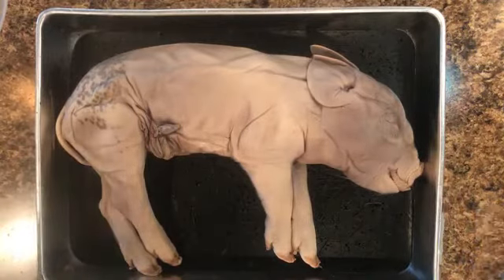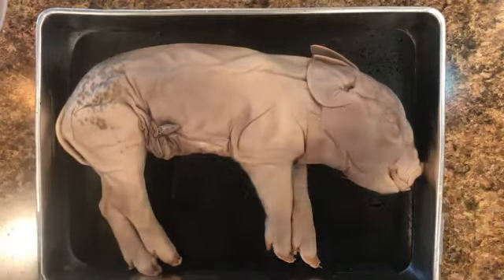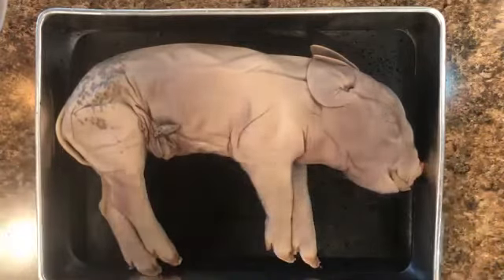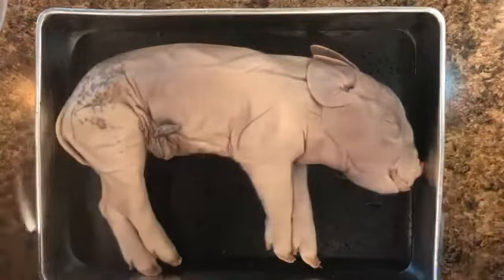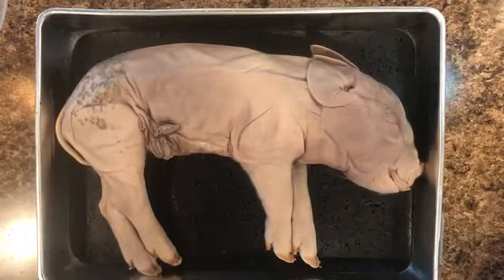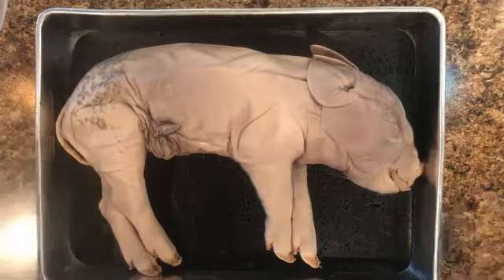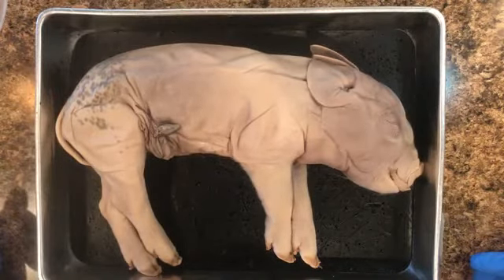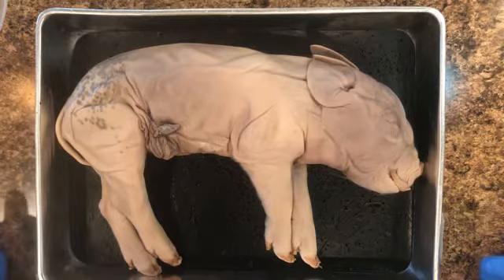Keep in mind, this is a fetal pig, so it was never born. It was not killed and now we're working with it. Like I said, it would have gone on to be disposed of in some other way. So we are using the fetal pig for educational purposes. We're going to look at the external anatomy of the pig first and some major body regions. Then we will determine the sex of this pig.